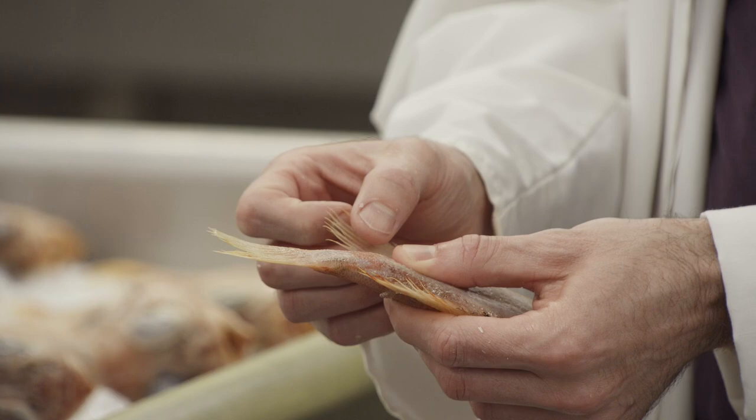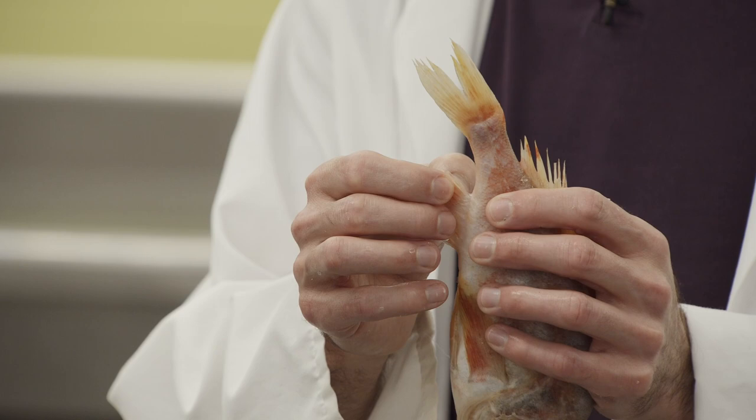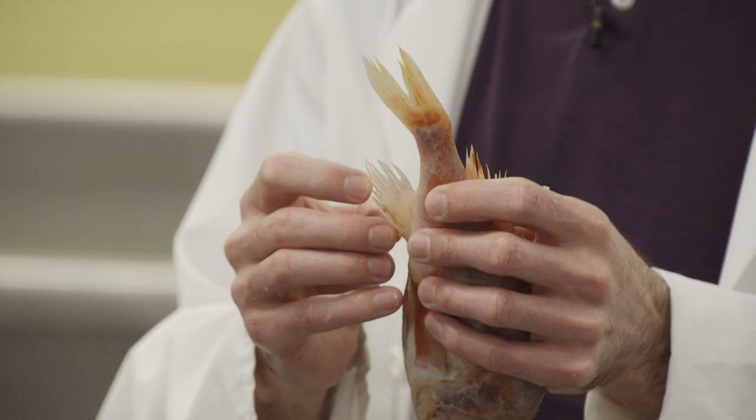Another thing to look at is the last ray. Sometimes it is detached from the other rays — sometimes the membrane is cut and the ray is stuck on the belly of the fish. So if you open the fin using the spines as shown, the last ray can remain stuck and thus you will not be able to count it, making the count false.